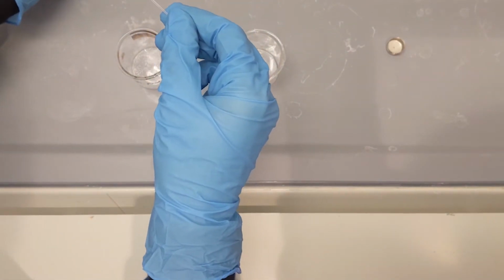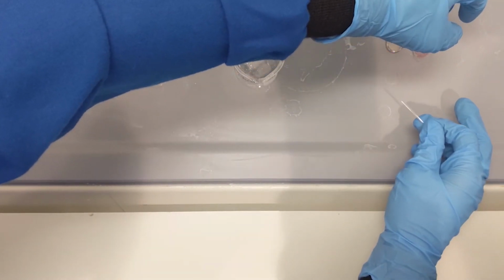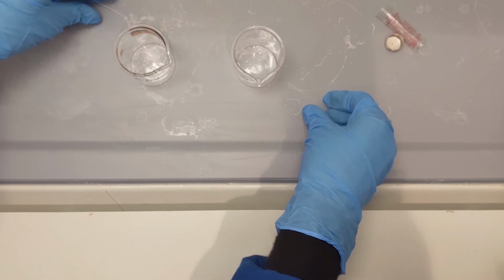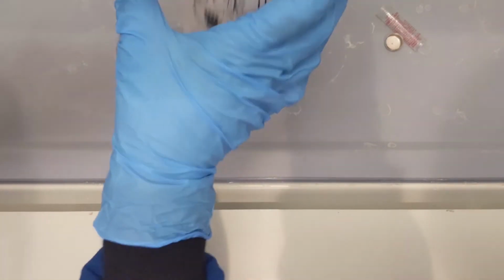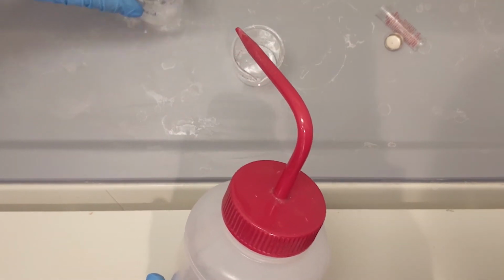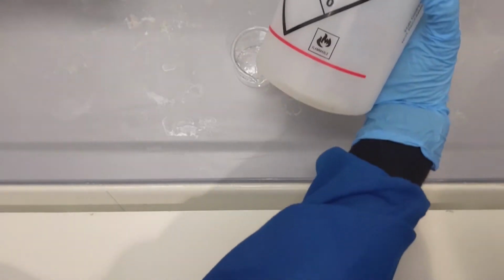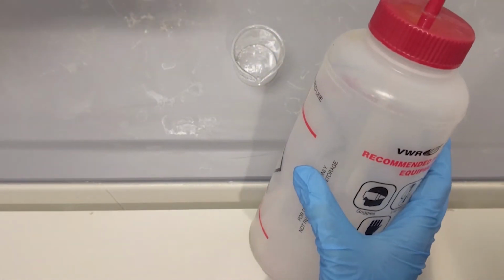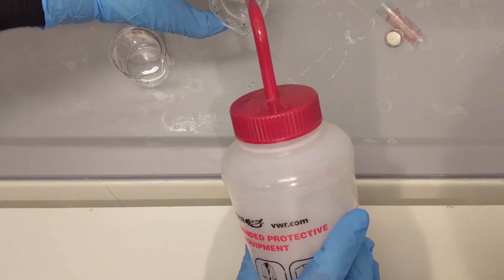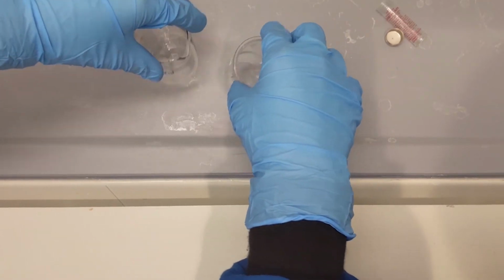Then proceed to use a microcapillary tube to spot each of these compounds onto a TLC plate that you have marked beforehand with a pencil. You may want to spot your compounds on your marks more than once if your solution is too dilute. Then place it into your solvent system, which is 1:1 ethyl acetate and hexane, and let it run.